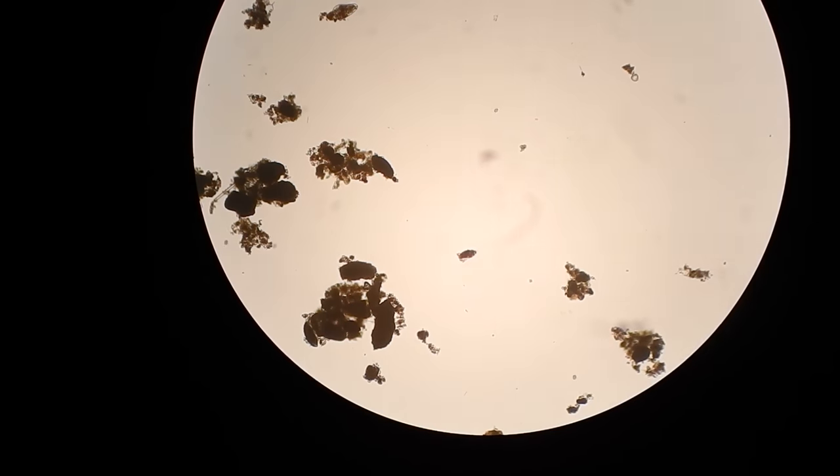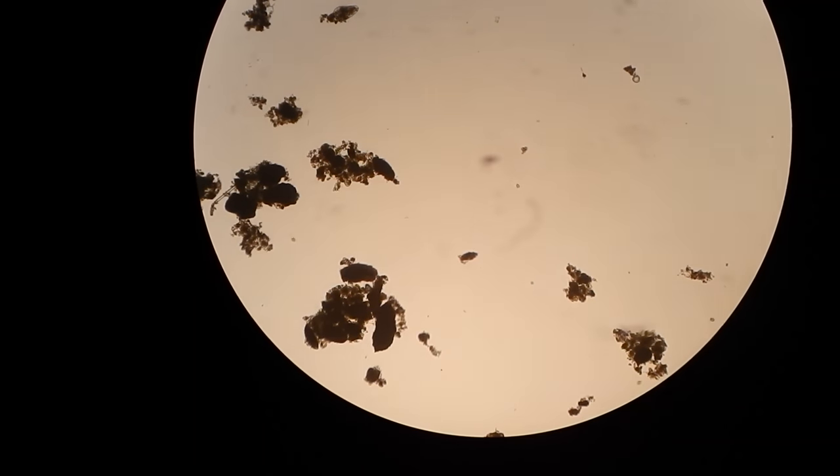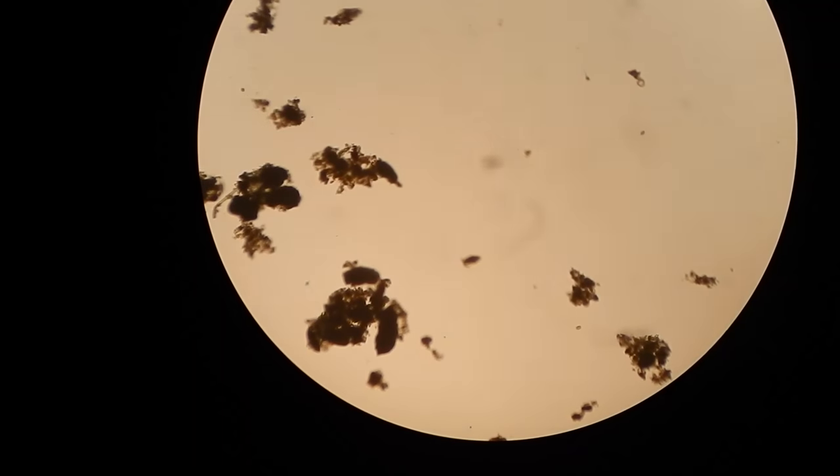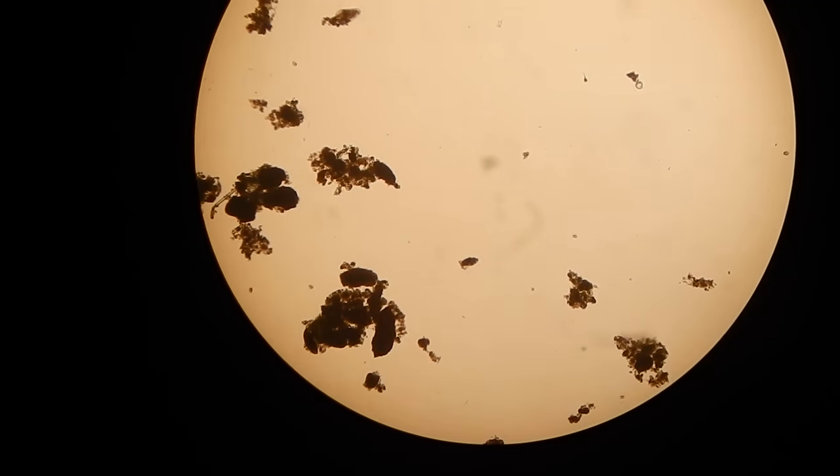Oh, lots of things swimming around in there. I'll turn that light down a little. Okay, so I have some creatures moving around, you can see.